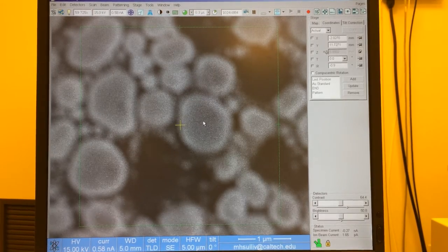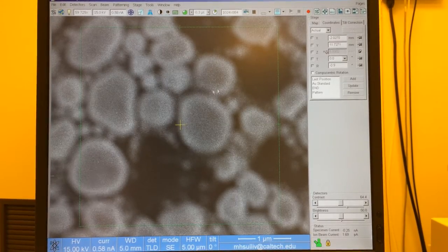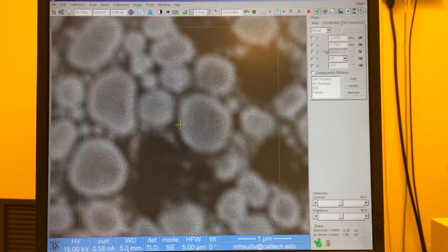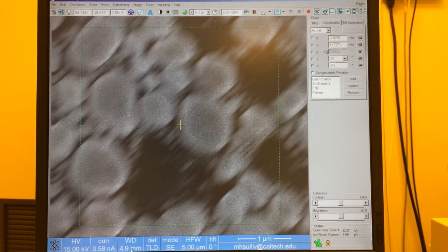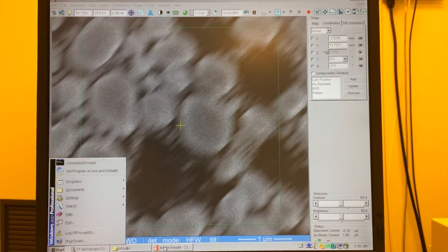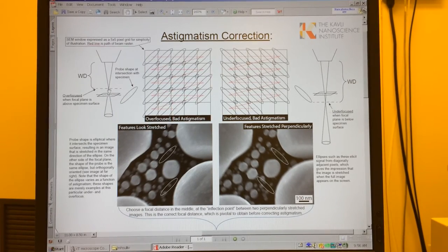So I want you to understand how that works and why that works. Here, when we see our image is blurry, I'm saying we're at focus and we're at 5 millimeters working distance. If I bring the focus to the left and I induce that diagonal stretch, now I'm at 4.9 millimeters working distance. If we look at our diagrams, we're in this situation here. So we've now brought the focal plane above the sample surface. It was at 5, and now we're sitting at 4.9 above.